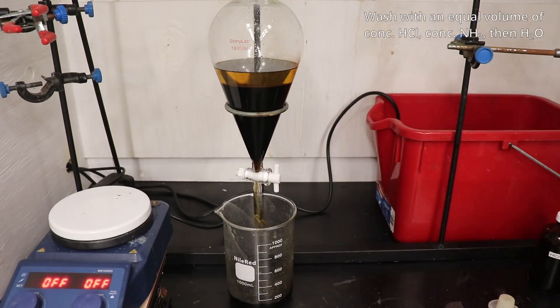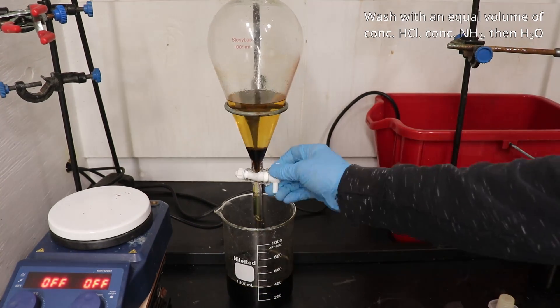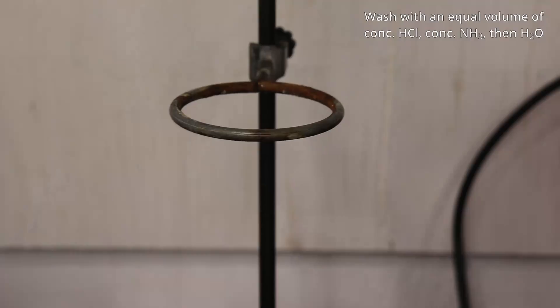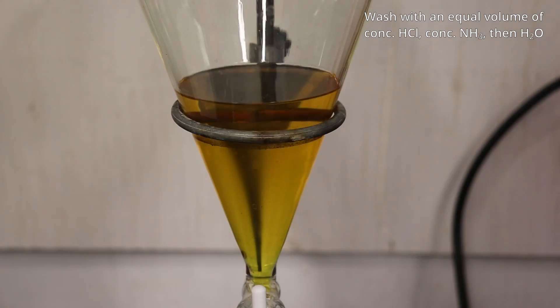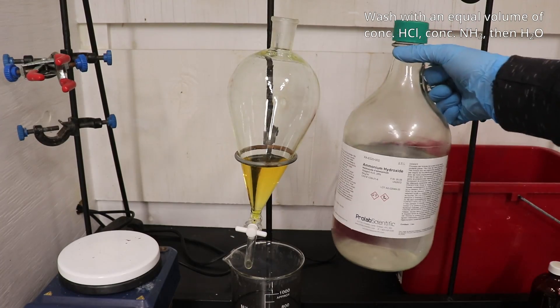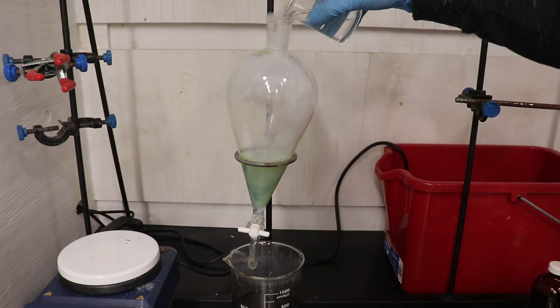The solution was transferred into a separatory funnel and the lower aqueous phase was drained off. Then the organic phase was washed with an equal volume of hydrochloric acid, then concentrated ammonia, and finally water.